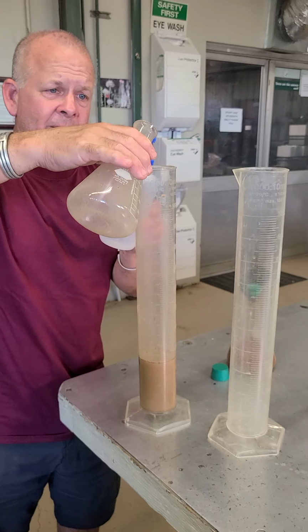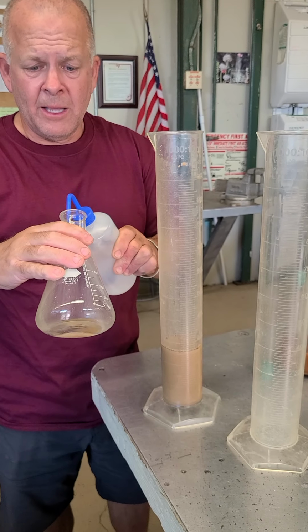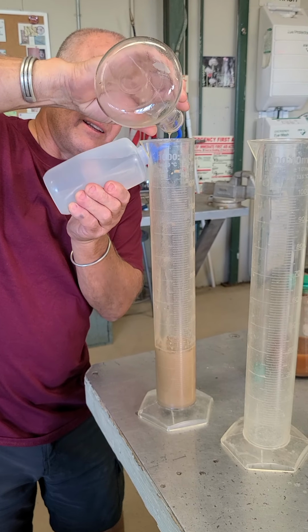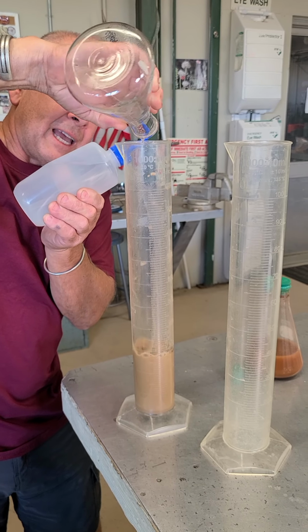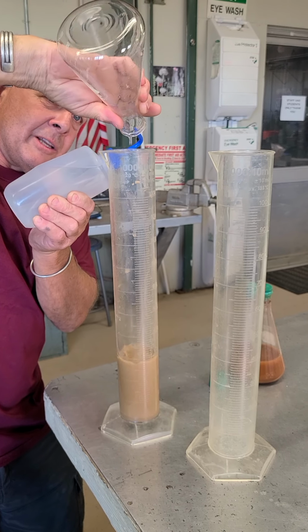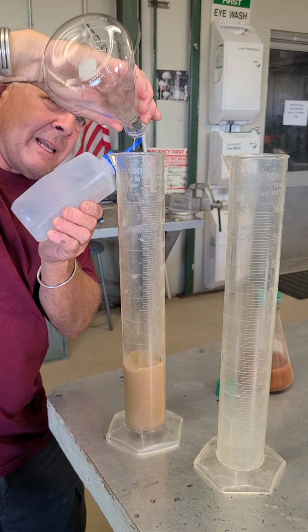So what I can do is squirt a little bit of this liquid in there. It's distilled water again. That's what I have to use, and I can go ahead and pour it in like that. So it's kind of a tedious process. It can be. You've got to be careful that you rinse it out and keep it tilted into the cylinder. But eventually you'll go ahead and get it.